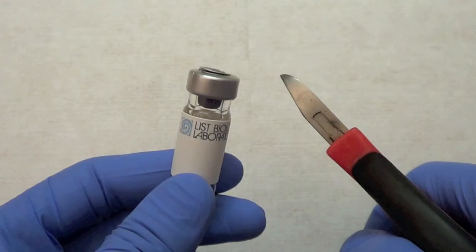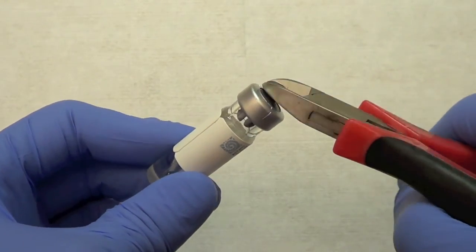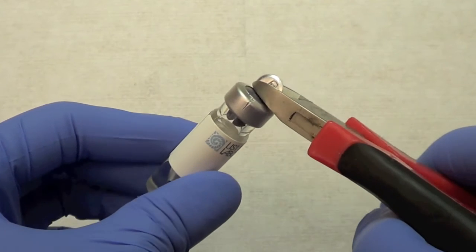Now you're ready to open the vial. Use pliers, forceps, hemostat, or an equivalent tool to lift the center tab. Slowly peel back the tab.